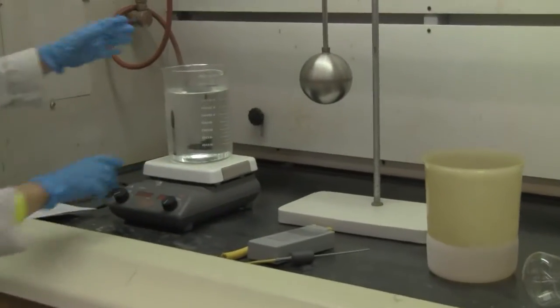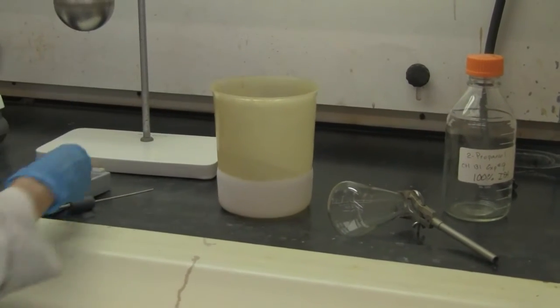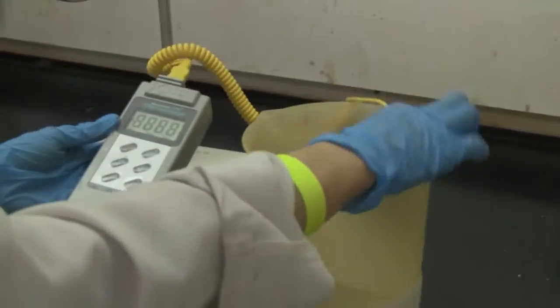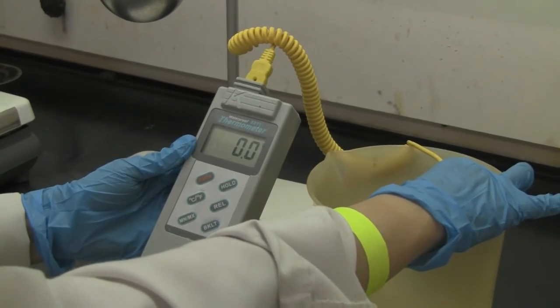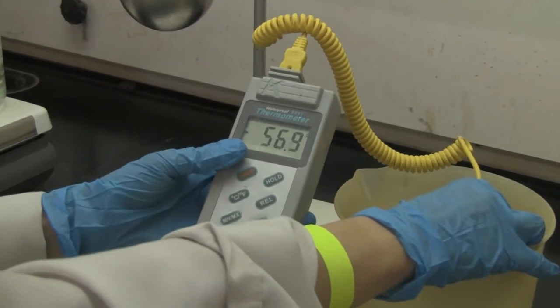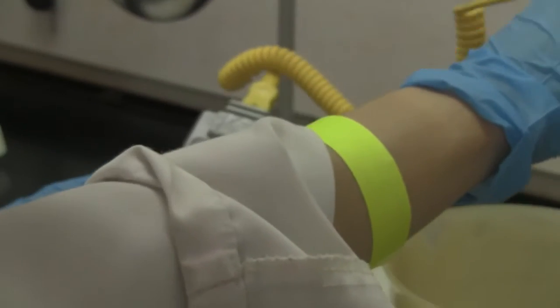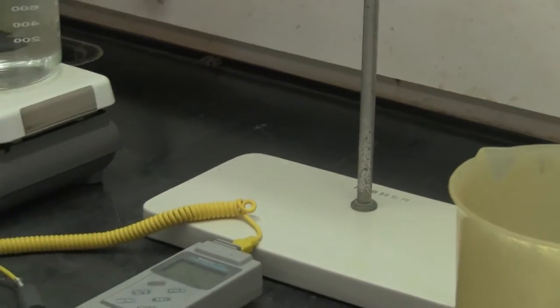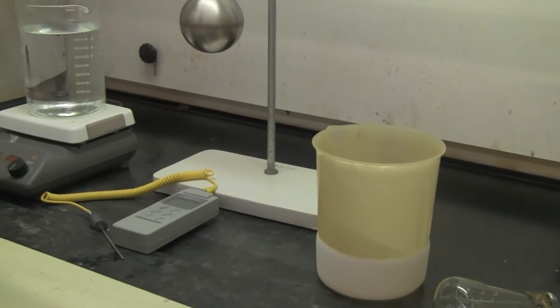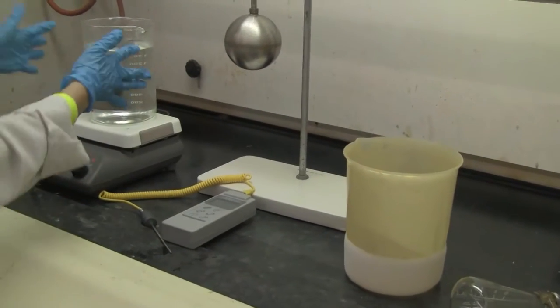Now one is the hot water, one is a very cold liquid. If you want to see how cold the liquid will be, we can take a look at the temperature. Negative 56.8, 57 degrees Celsius. So that's very, very cold liquid there. How did I make it? I put some isopropyl alcohol, like a rubbing alcohol, and I put some dry ice there to lower the temperature. Okay, so we have a very cold temperature tank, very hot temperature tank.